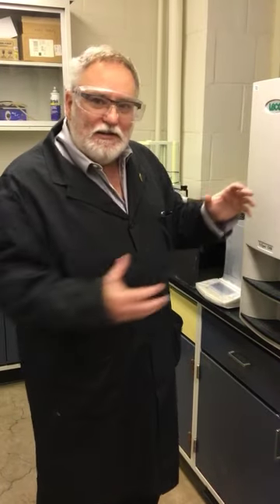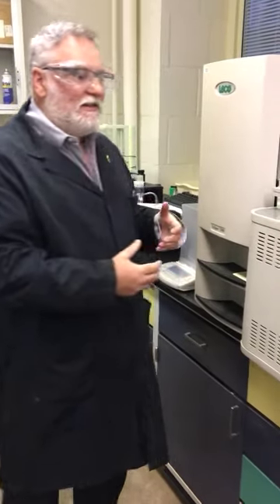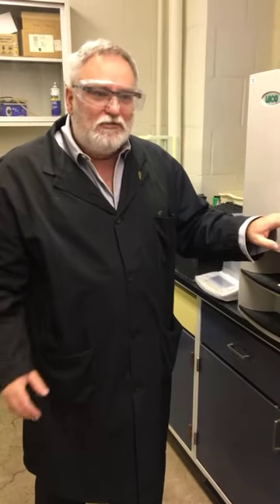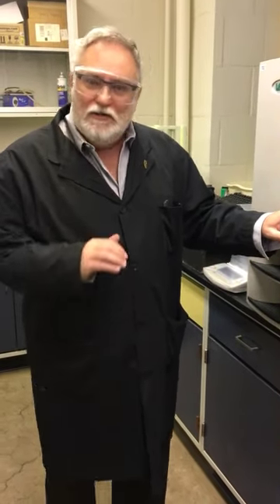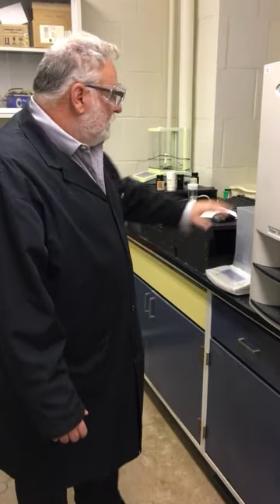They're sometimes called blanks. We don't treat them as blanks because we aren't going to take that data away from the results we get. What happens is I'll find a high nitrogen signal that's been sitting over the weekend because air has infiltrated the system. So the purge process will take helium through the system. It goes through the process of doing an analysis, it's just that there's no actual sample added into the instrument. So through about 5 conditioning runs, again to the point where I get a reasonable background level of nitrogen, so very low contributions.